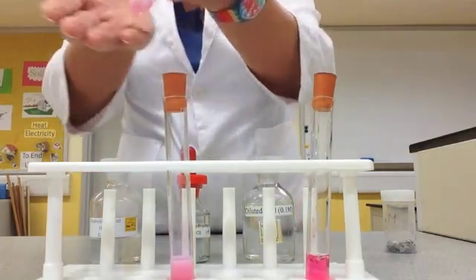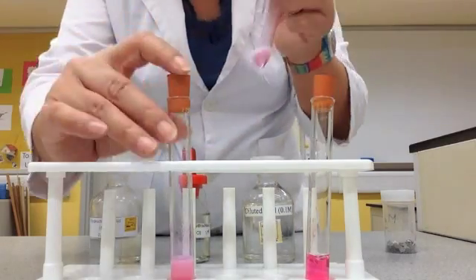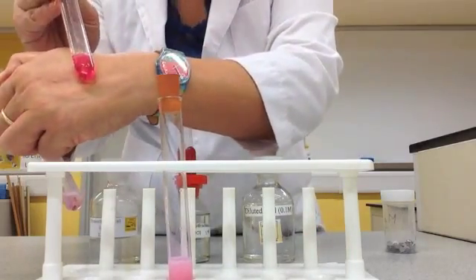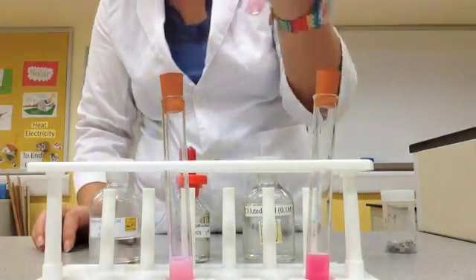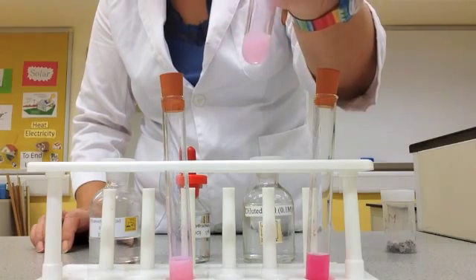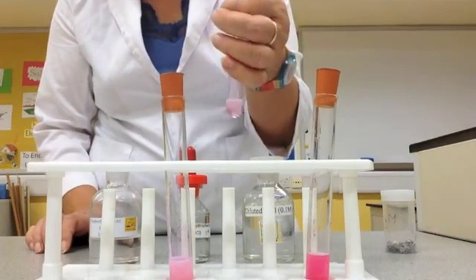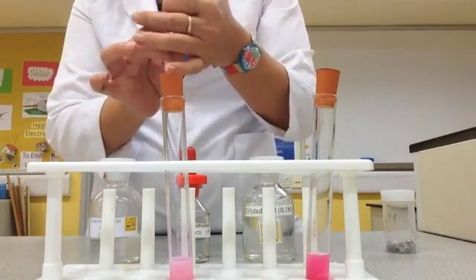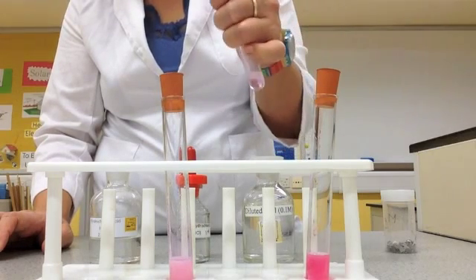If you touch it — I know some of you touched it — this is very, very warm. I wish we had a good thermometer. This one is not as warm, and this one hardly any heat, and hardly any bubbles as well, but there are bubbles. Now I'm trying to collect some more hydrogen — I'm using my thumb to cap it so I can feel the air push. You can actually feel when there's a lot of hydrogen already; it pushes against your thumb. When you get to year 9, you'll be able to do this experiment.